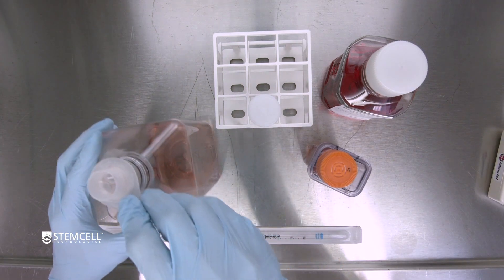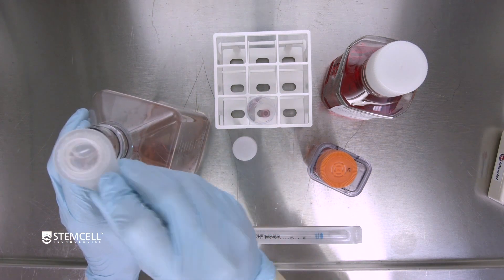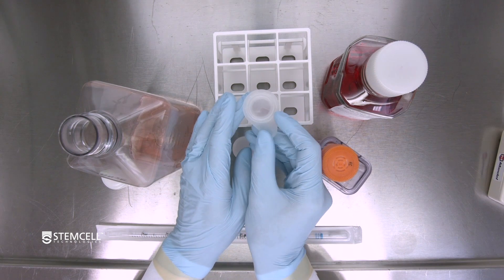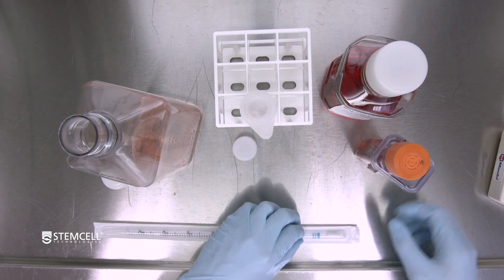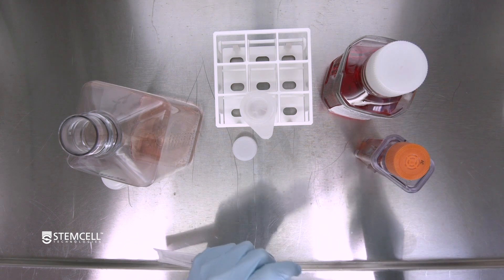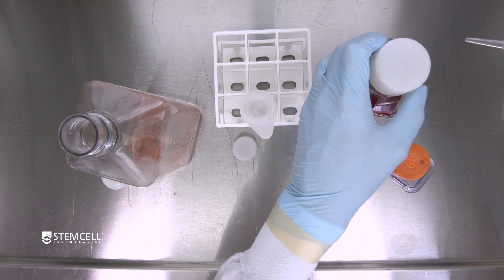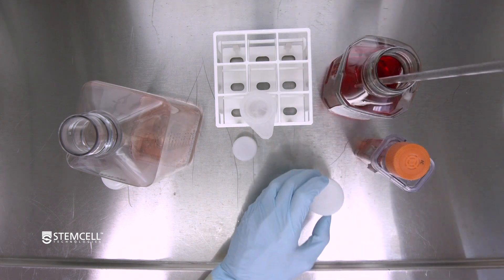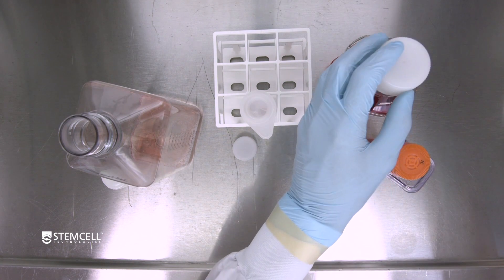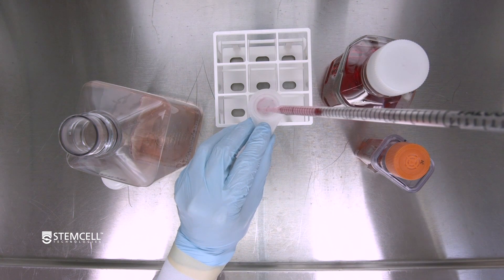Next, flip the filter strainer over onto a 50 ml aggregate recovery tube so that the captured aggregates are on the bottom. Then, using fresh media, wash the aggregates off the bottom of the filter with 2 to 5 mls of fresh media.